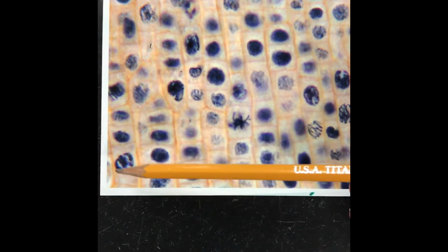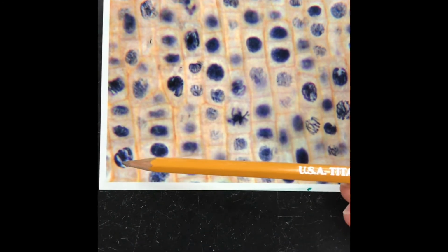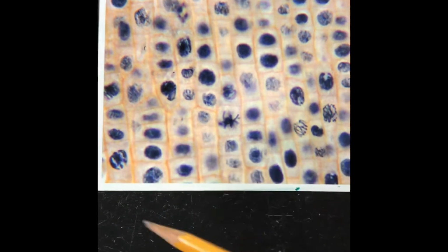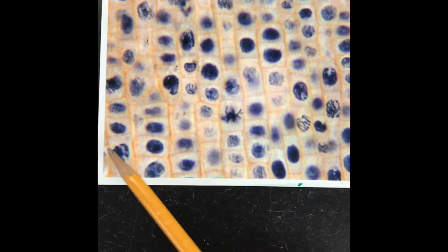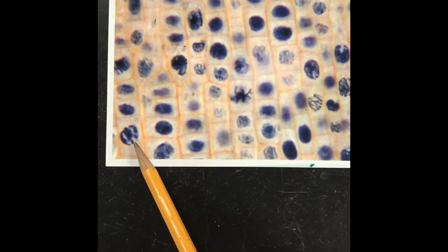And so the nucleus in this picture, it's still kind of intact, but do you see how there's lots of white space in the nucleus? This particular picture right here, this is prophase. So what you can see is the disintegration of the nuclear envelope in this area right here, and the DNA is thickening and coiling and condensing. So this is a definite prophase. So that would count for 1 over here when you're doing the M phase. That counts for 1 cell that's in M phase.